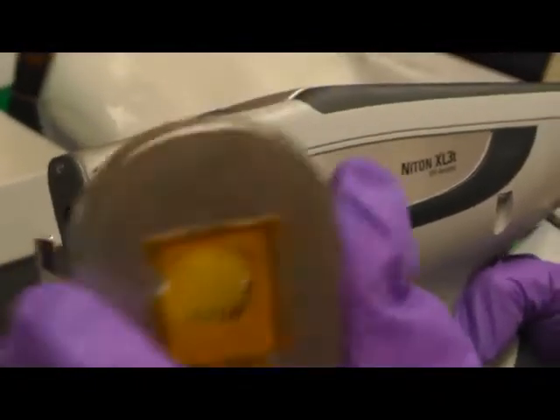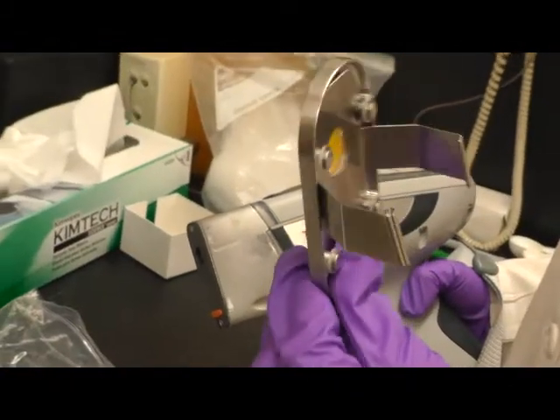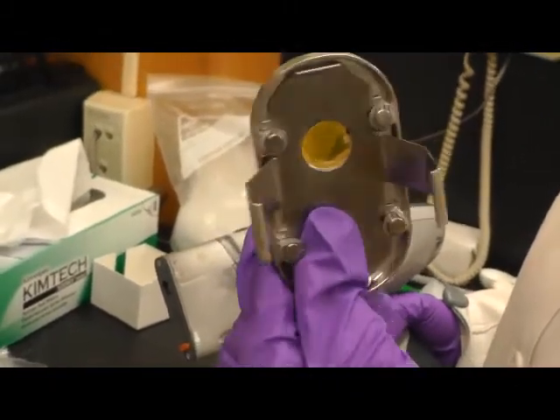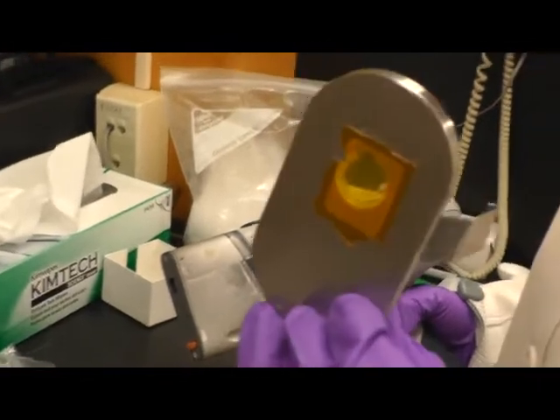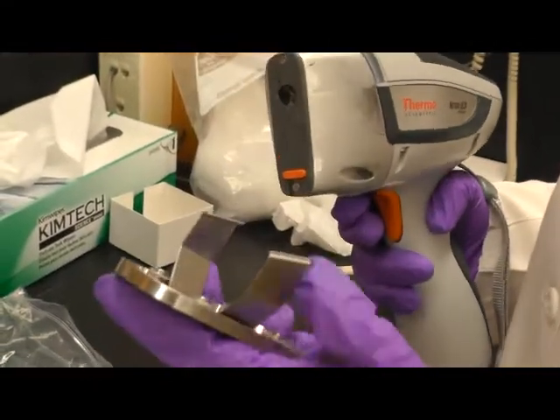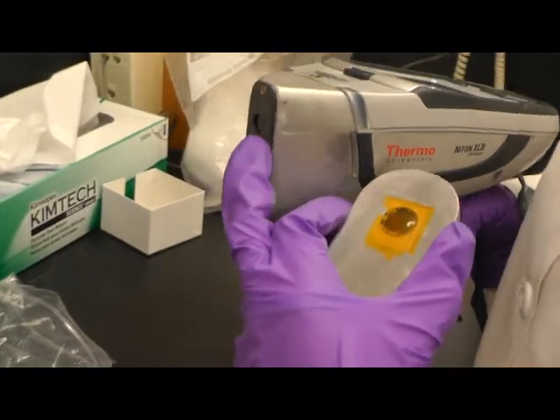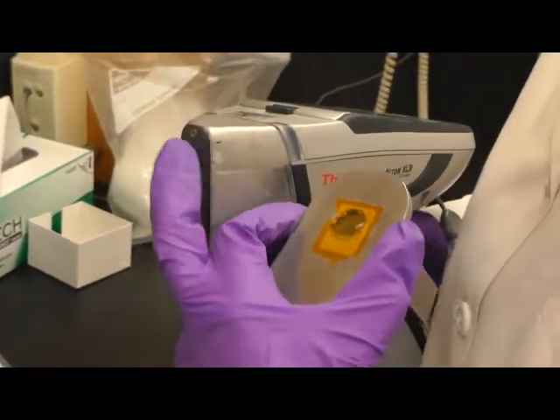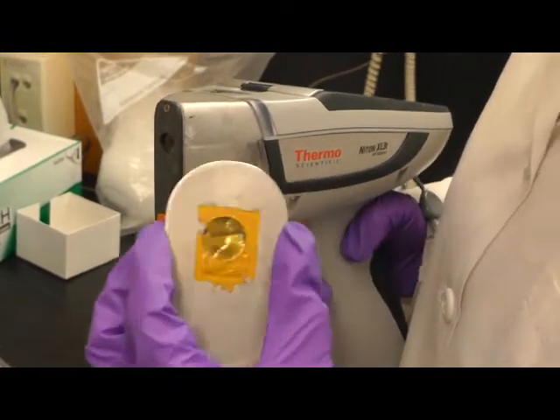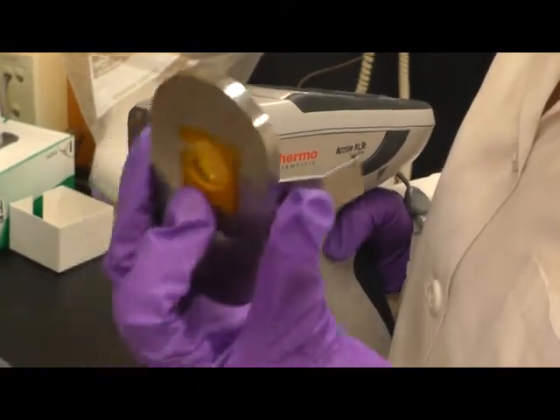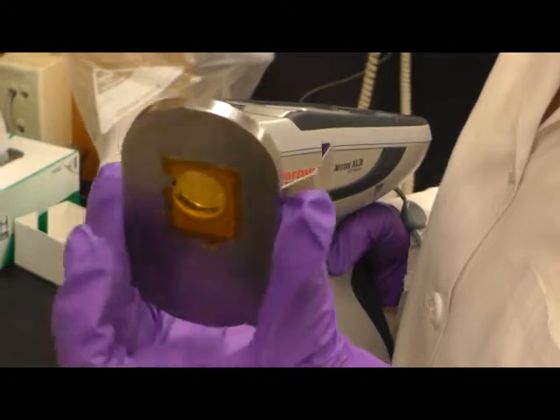There is another piece come with XRF instrument. It looks like this. And I will put this piece in the front of the XRF. And here's where this hole is where XRF gun is going to come out. And make sure it aligns with the hole in this piece as well.